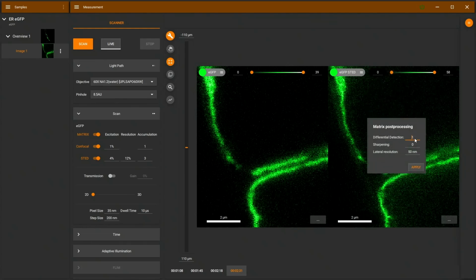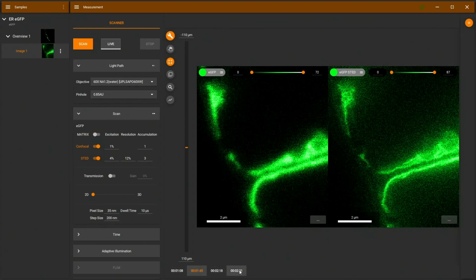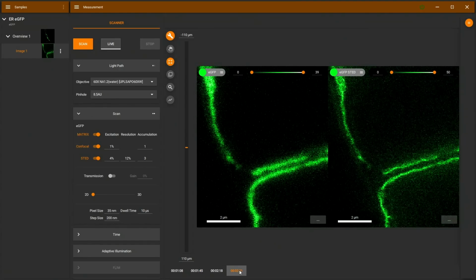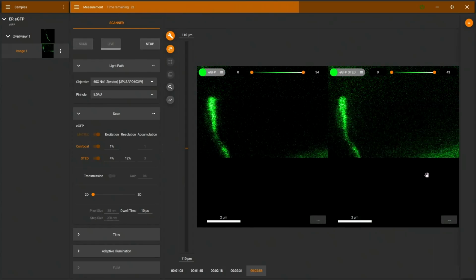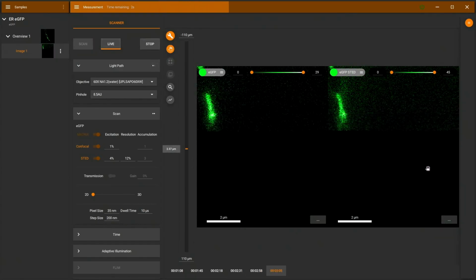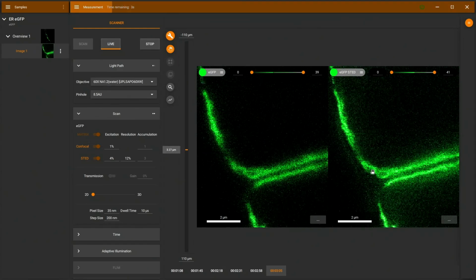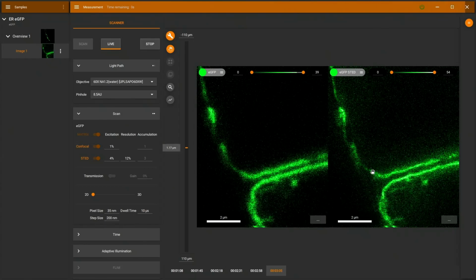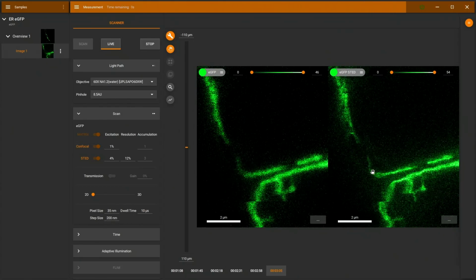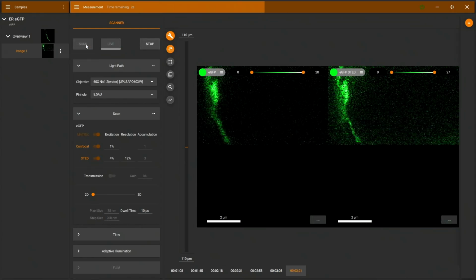Going to post-processing, we can see with differential detection even less haze, and I think the STED image is a lot sharper compared here to the confocal image and here matrix detection. So I think especially in STED mode we can see the difference here between matrix and confocal detection. Scan again, and I think now we're getting a few more strings here. Yes, that looks nice. There we go. So I'll stop here and scan once more.